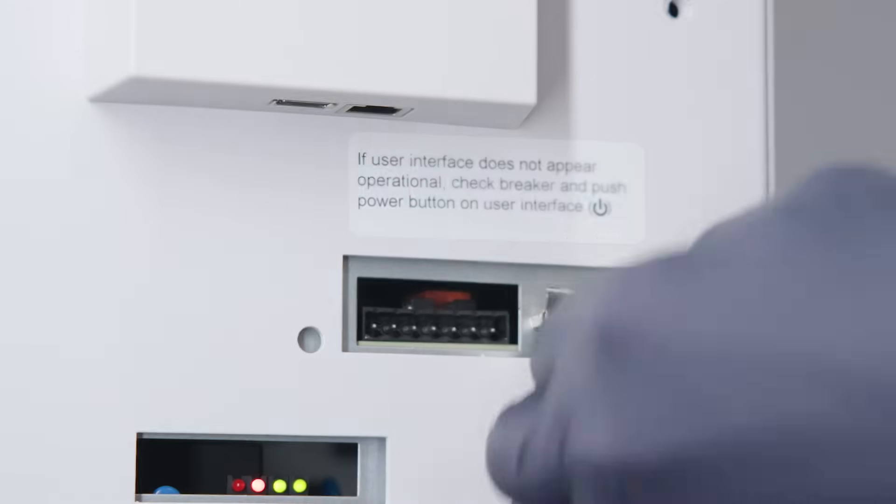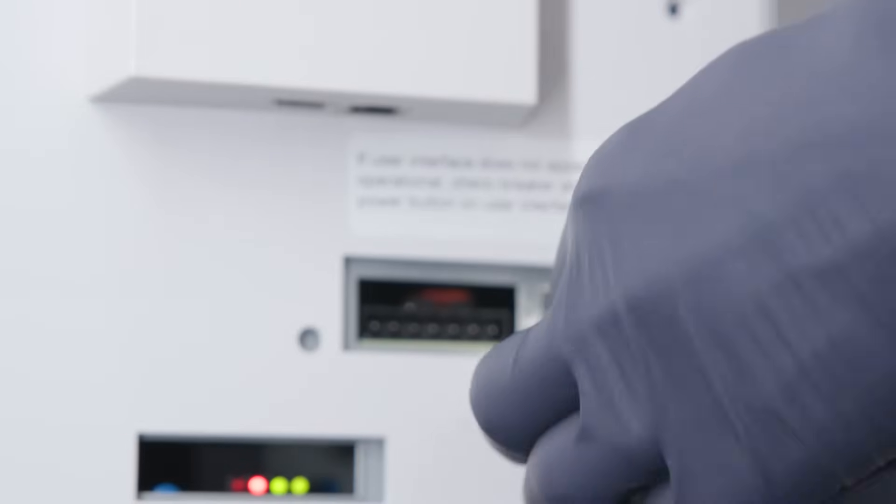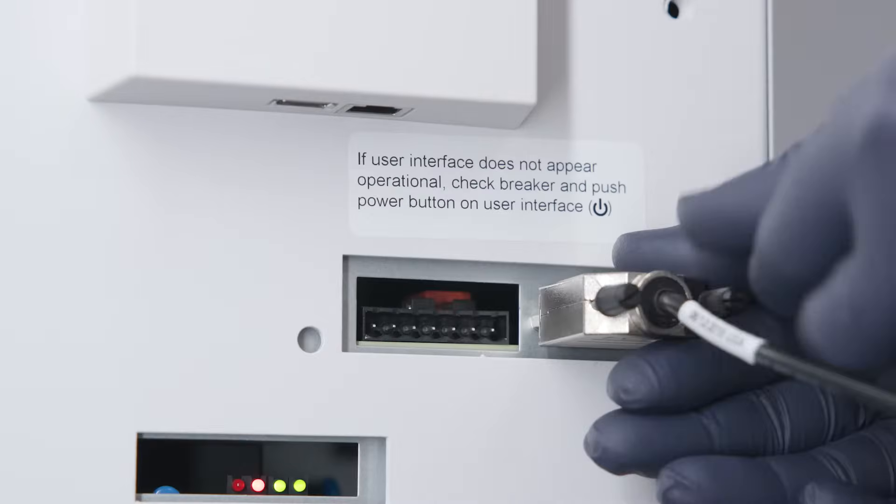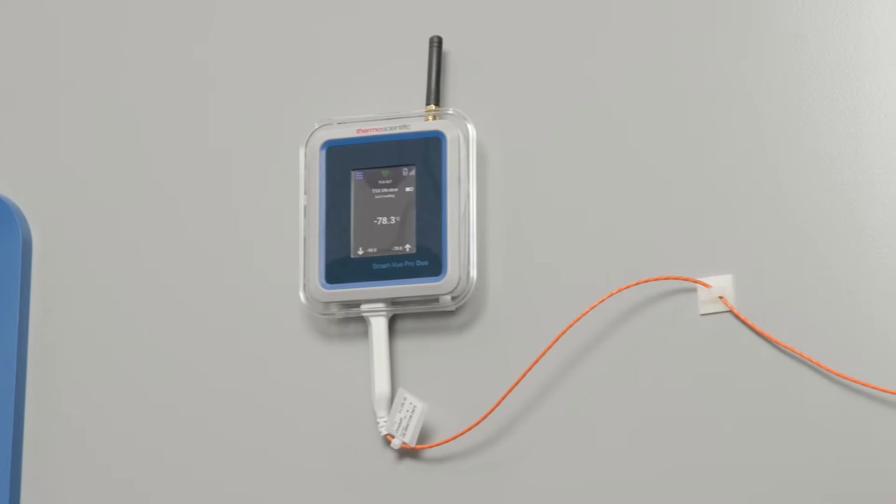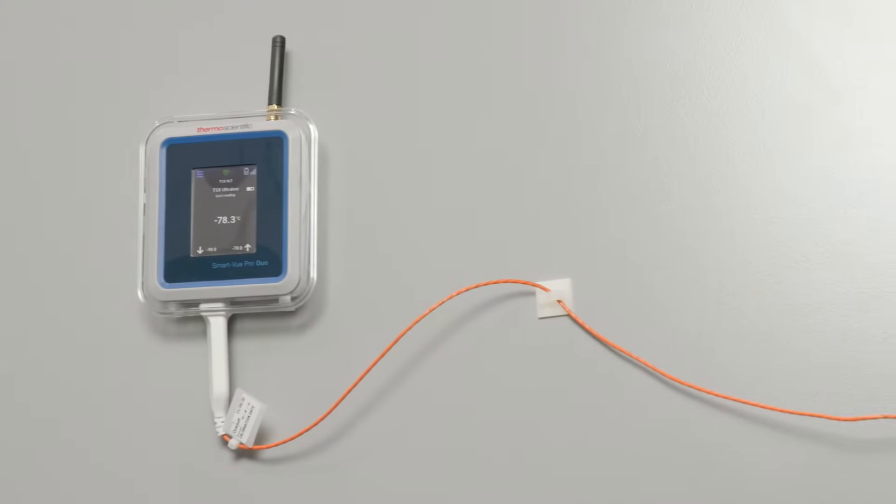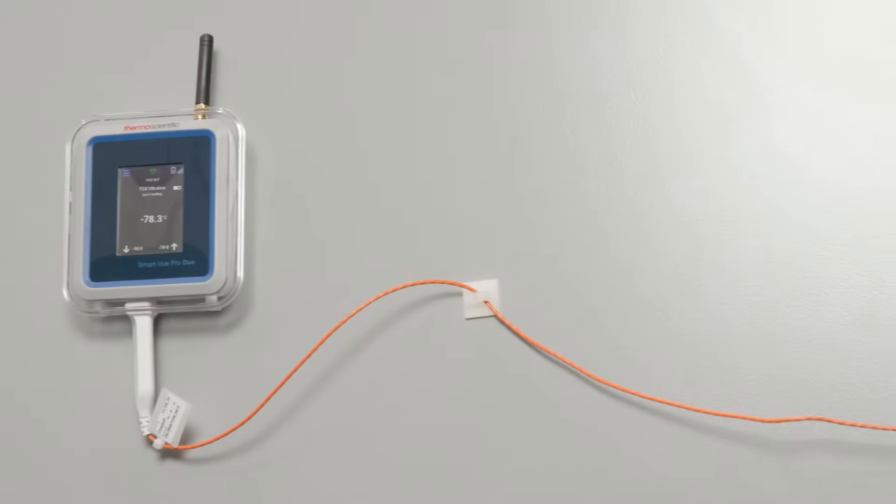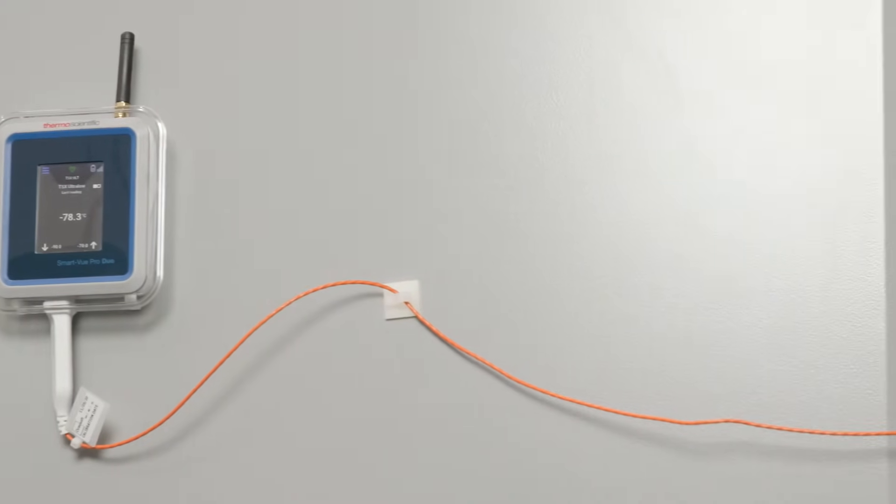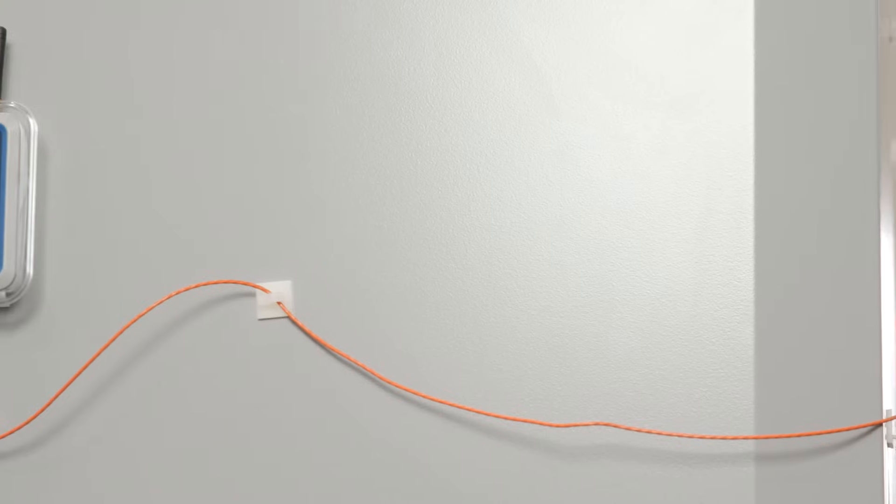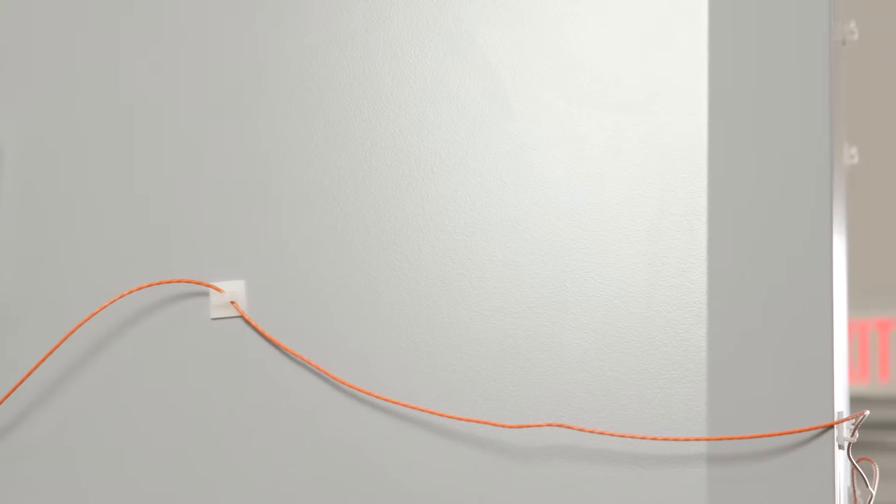Connectivity and remote monitoring systems require power. While batteries can be a great solution, a long-term, steady flow of power is essential to help ensure uninterrupted monitoring of your equipment and ultimately, your samples.